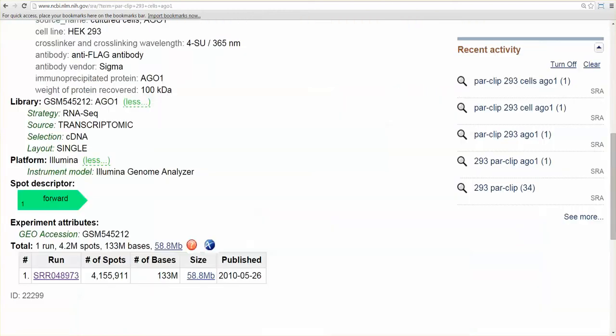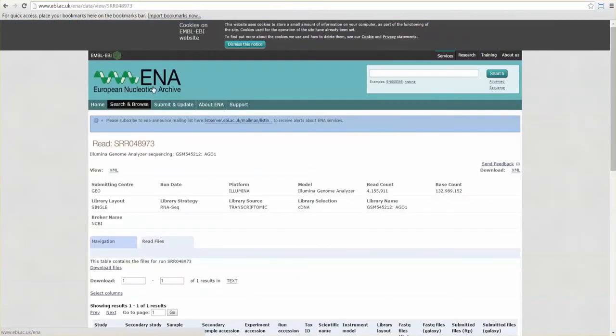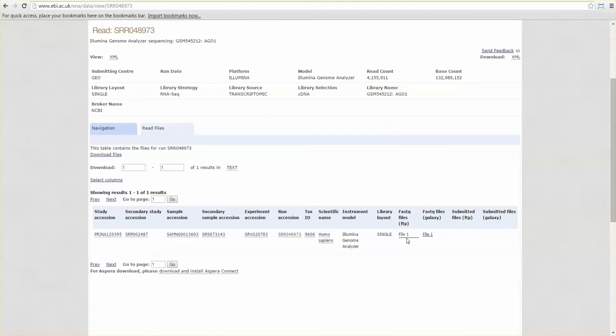Okay, so once you found a data set you're interested in, how do you download it? You can just go to that run number in SRA, and they have a method for downloading, but I prefer to just go to the European Nucleotide Archive and paste in the run number there, and then you just get this simple download link. Okay, so how are we going to analyze this data?